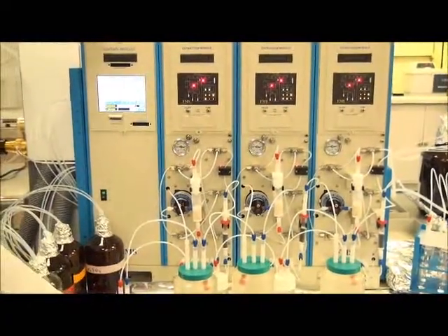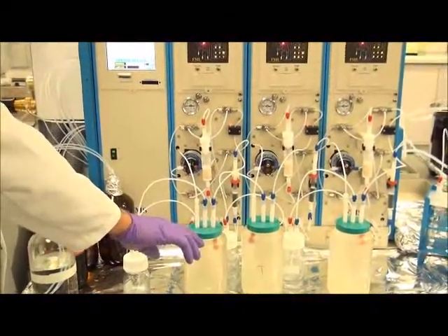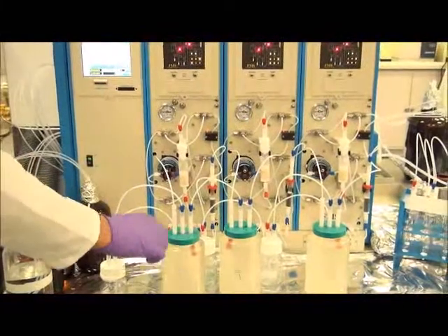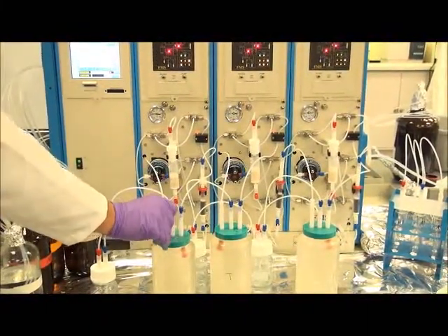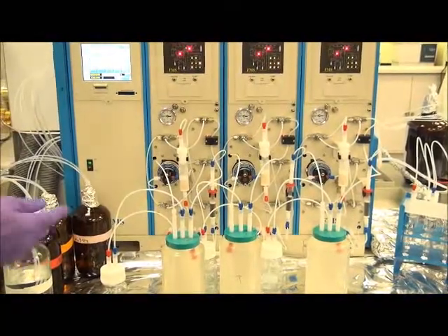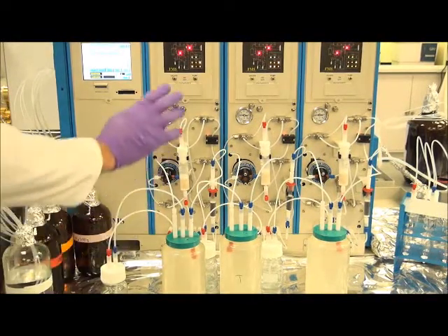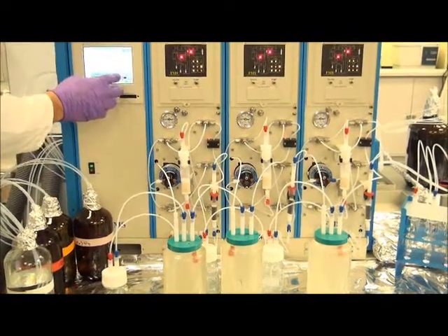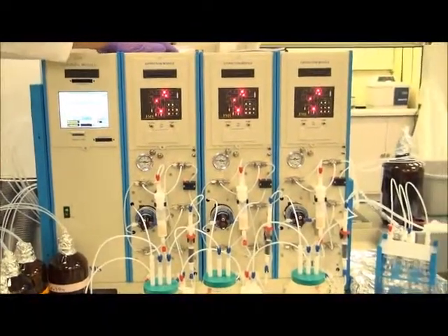Next to each bottle is a small reservoir of methylene chloride, which after the sample is loaded will spray methylene chloride along the sample bottle walls, and then the other line will draw that methylene chloride up, adding it to the extract to cover both the bottle rinsing as well as the cartridge elution without any interaction from the analyst. So at this time I will start the program, and the program will initiate.